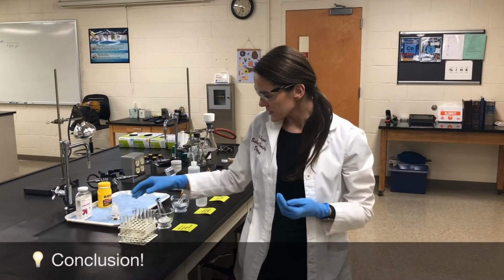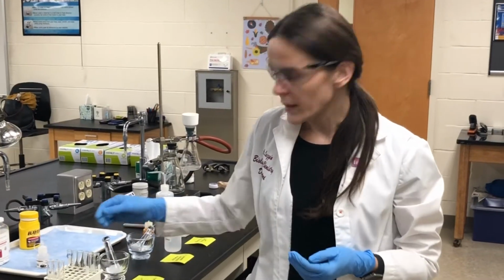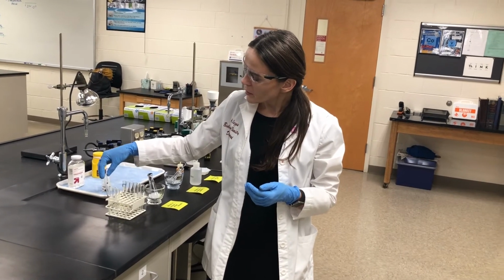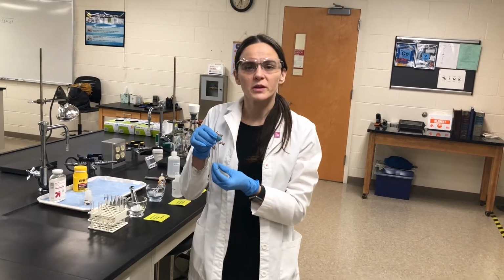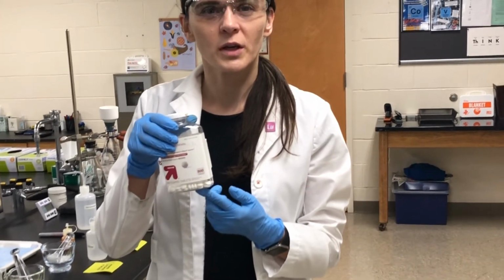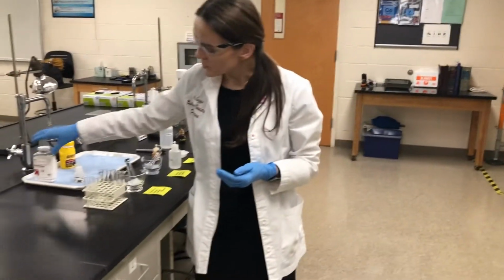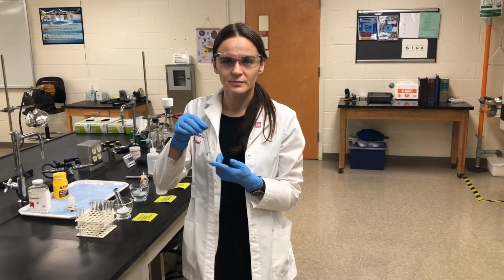In conclusion of our acid test, we can see that all of the aspirins are acidic, or at least slightly acidic, and that is true because aspirin does contain a carboxylic acid functional group. My Bayer aspirin is moderately acidic. Probably the generic aspirin is a bit more acidic, and the reason for that is if you look at the expiration date, it is 2013, and currently it's 2020, so it's a bit old. So it degraded a bit. And of course, my crude aspirin is impure, so it is the most acidic out of the 3.